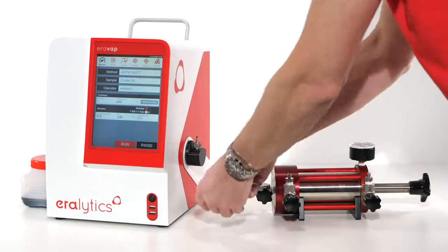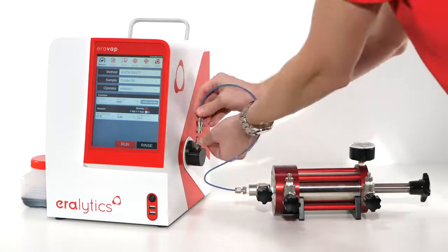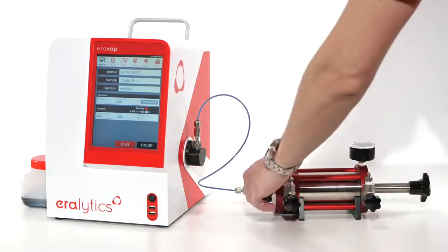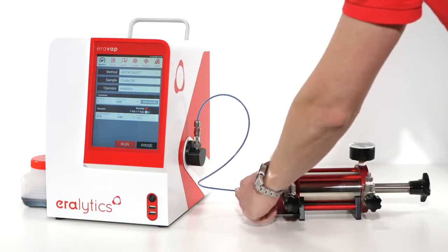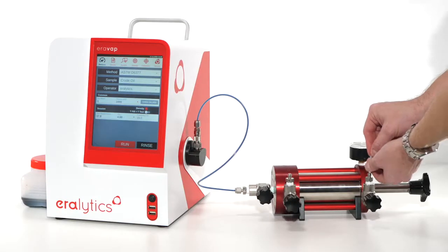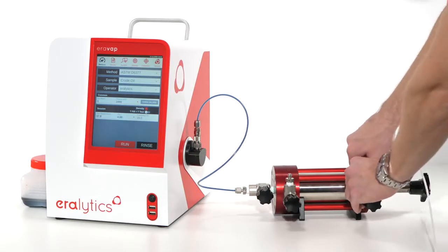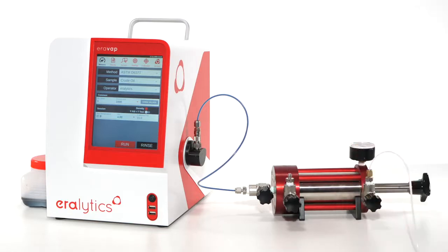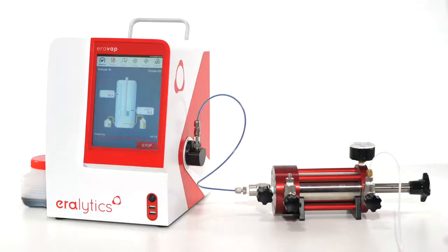Attach the MPC to the inlet assembly on the analyzer with the quick connector and slowly open the sampling valve. To maintain constant back pressure, it is recommended to connect the MPC to an inert gas line. Press the run button to start a fully automated measurement.